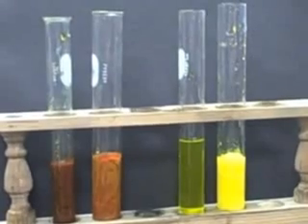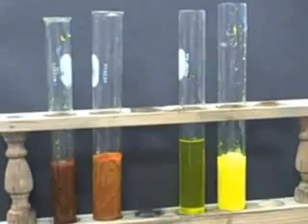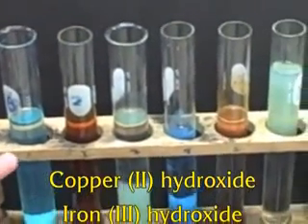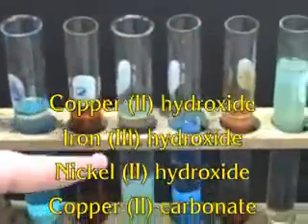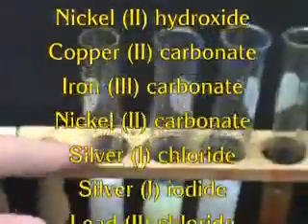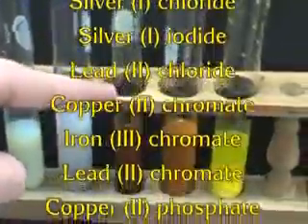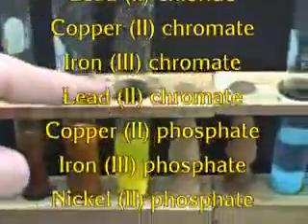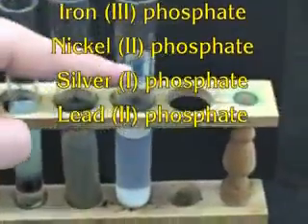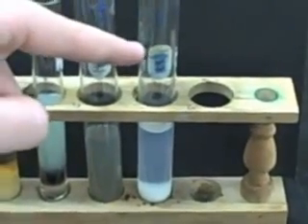And now we're going to do two that are classic and a real original one. And we're going to do those in flasks. So this is our final lineup here. We've got copper hydroxide, iron hydroxide, nickel hydroxide, copper carbonate, iron carbonate, nickel carbonate. Next rack, we've got silver chloride, silver iodide, and lead chloride. And then we've got copper chromate, iron chromate, and lead chromate. And then over here we've got copper phosphate, iron phosphate, nickel phosphate, silver phosphate, which has actually turned a blackish color, and lead phosphate, which is still milky white.